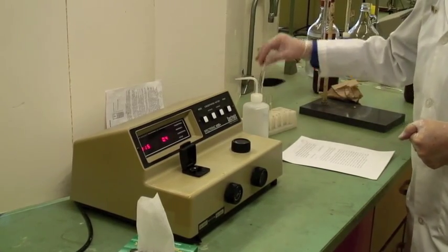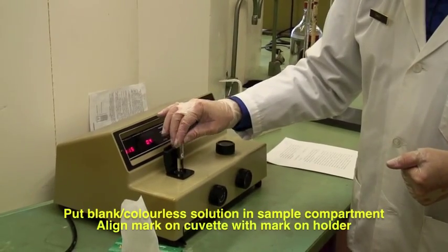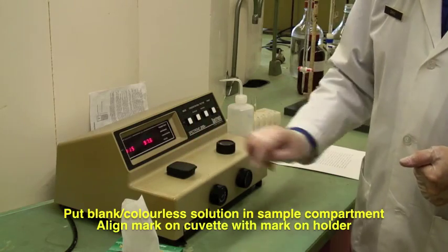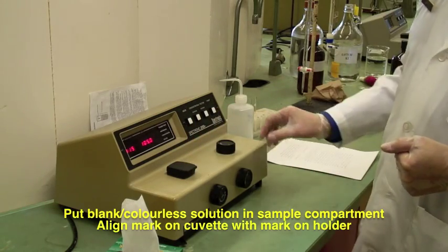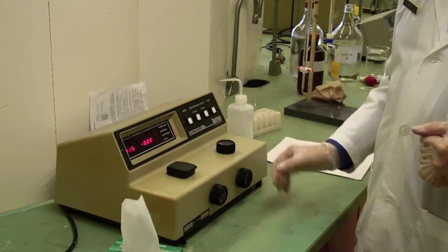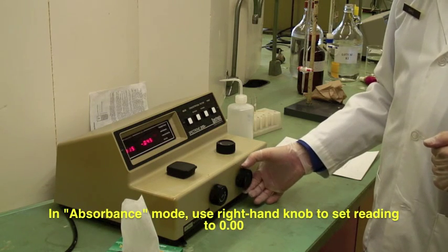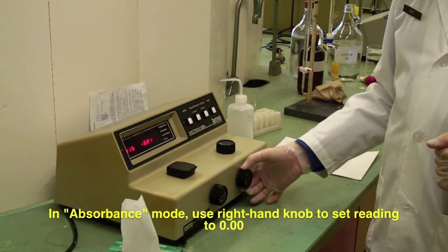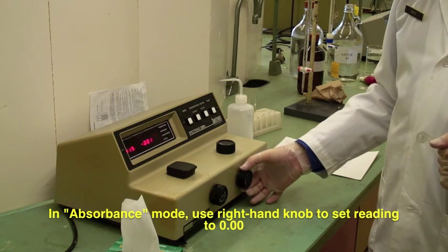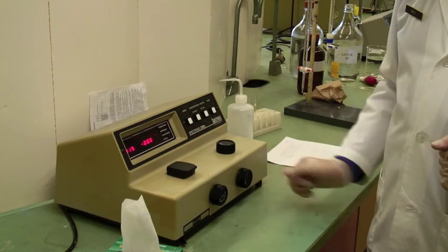I'll now take a solution of KI, which is colorless, and put it in. Make sure I line up that white bar to the tick at the front. Close the lid — that reads 105, it's not quite set. Put this to absorbance and adjust the other end with this knob. I want to set this one to zero absorbance — this is 100%, that's all of the light coming through, no light being absorbed.